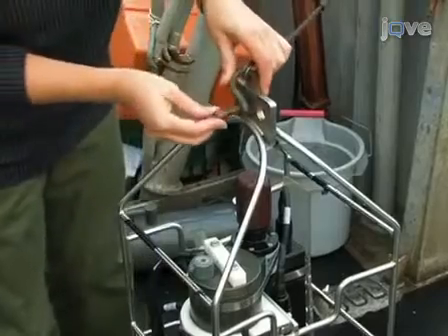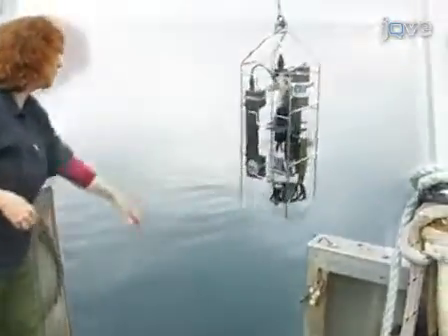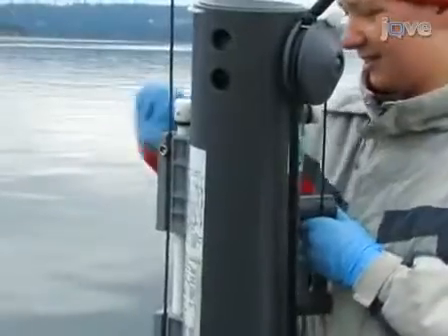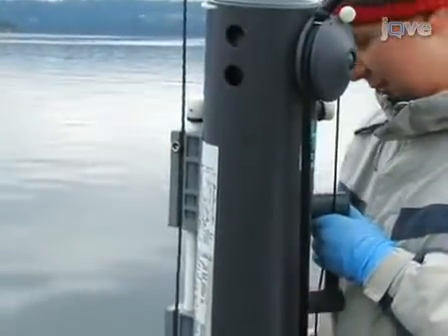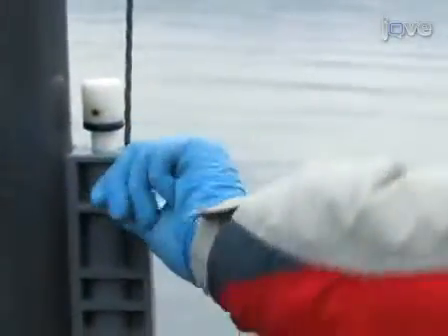Attach the CTD to the base of the line and lower it into the water. For the deepest depth in the profile, rig a sampling device onto the line immediately following the CTD. Make sure that the line is properly fitted into the device bracket and the screws are tightened.